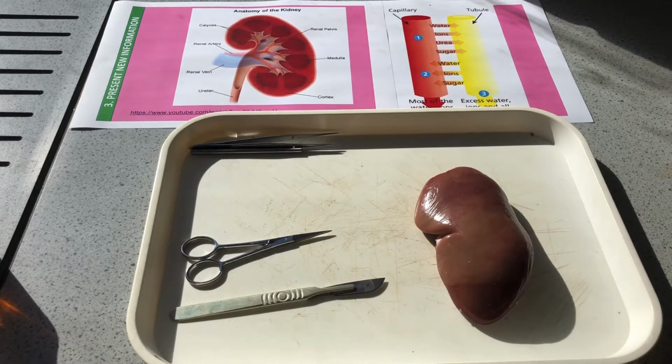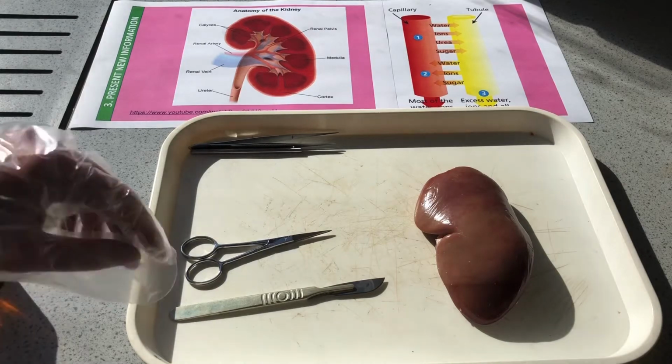Any of those amino acids that we've eaten from digested proteins that aren't used by the body to build up new proteins go to the liver. In the liver, they become ammonia, and then, because it's toxic, they are quickly converted from ammonia into urea. That urea then travels through the blood to the kidneys, and in the kidneys it becomes urine. So let's have a look at our kidney.